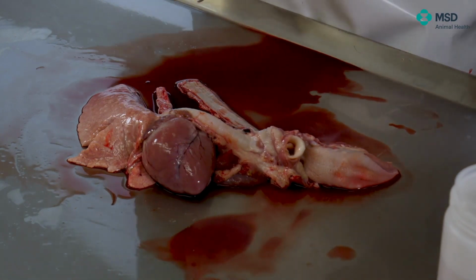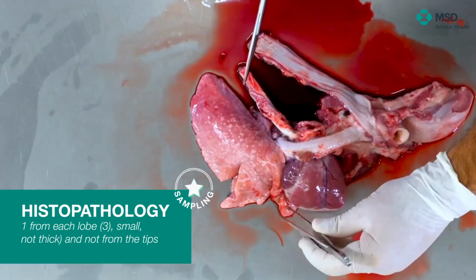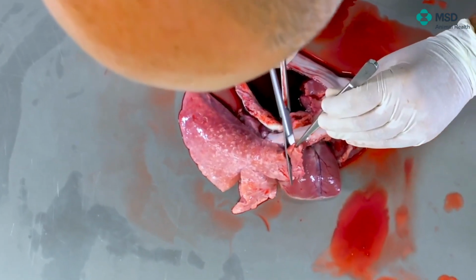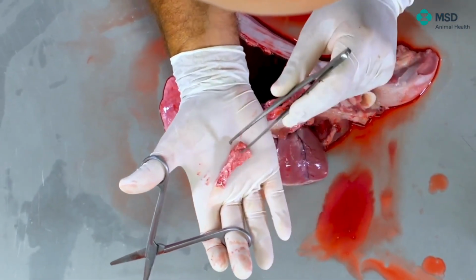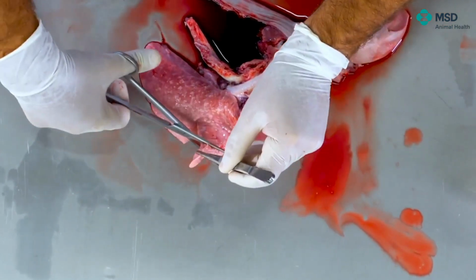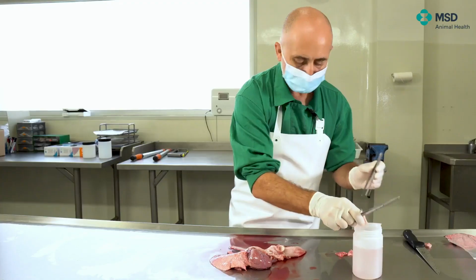We always recommend to take samples of the apical and middle lobe, as well as the diaphragmatic lobe. However, especially on the cranial part, even for viruses which is much more distributed, except for influenza. In influenza it is also much more cranioventral. But what we do usually is to discard the apical part and take one piece, as you can see, relatively easy to see and not very wide in order to facilitate fixation. So this is the part of apical.